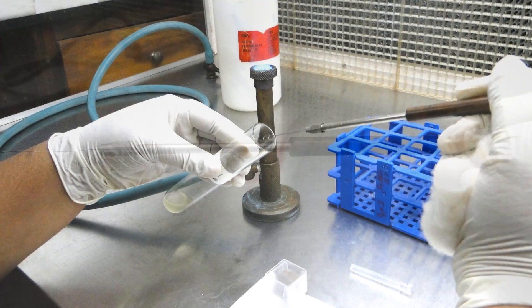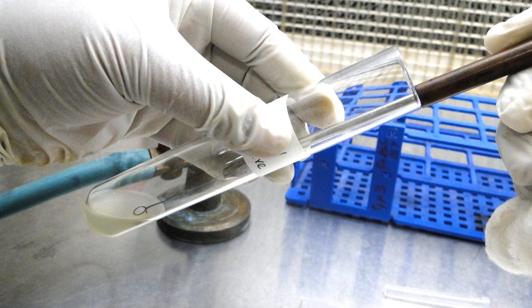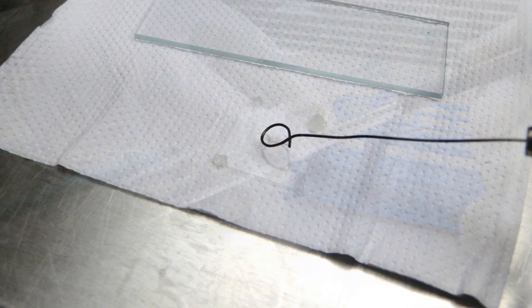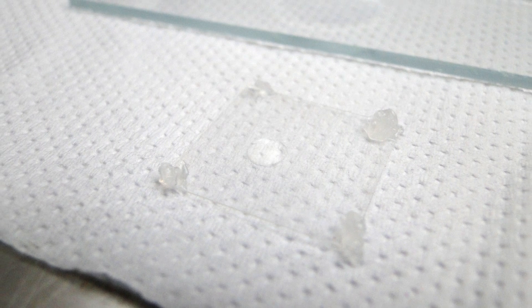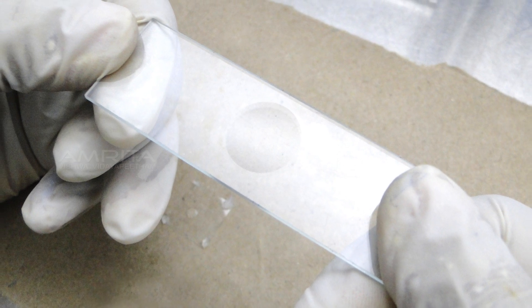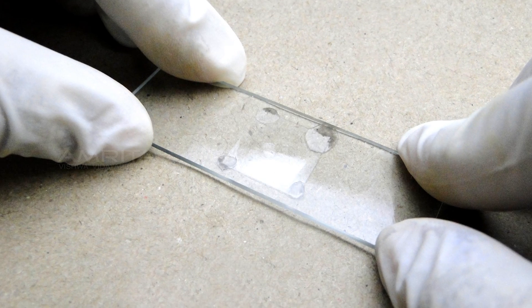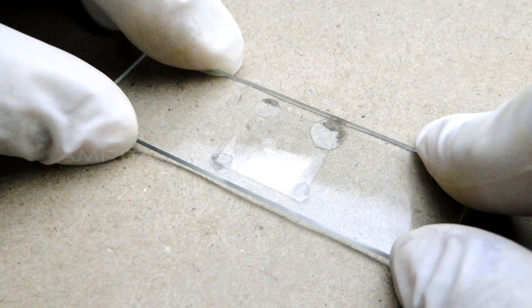Now with the sterilized loop, take a loopful of bacterial culture. Place a small drop of the culture at the center of the coverslip. Take the depression slide and lower it with the concavity facing down onto the coverslip so that the drop protrudes into the center of the concavity of the slide.